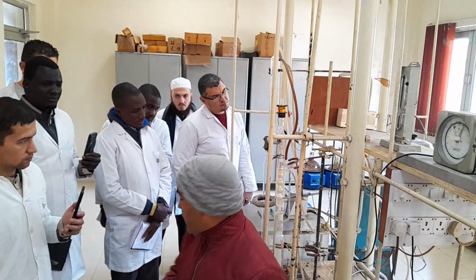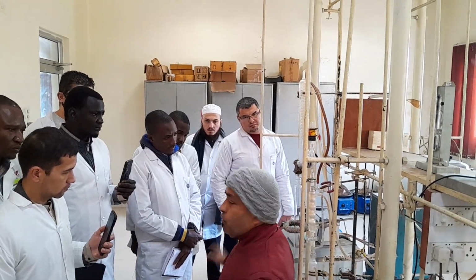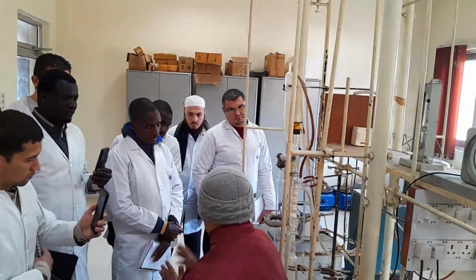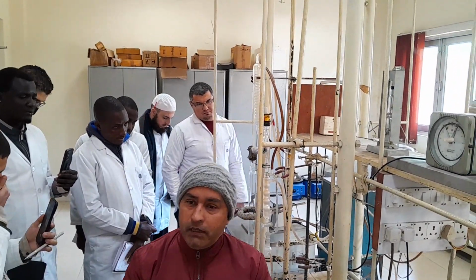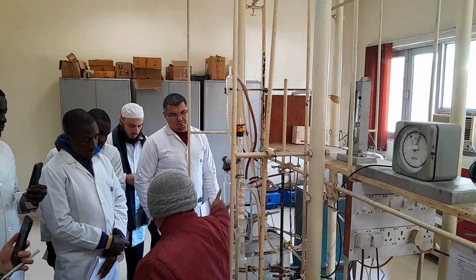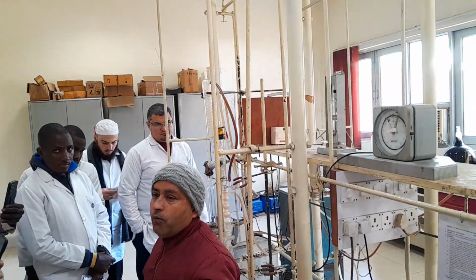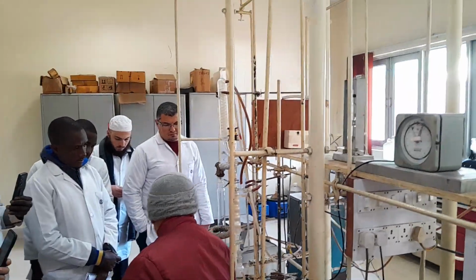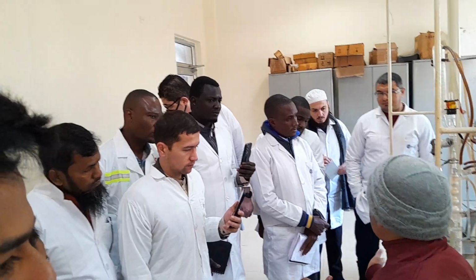Okay, so now the question is coming: how do I come to know my water has been removed? See, if there is water inside the crude oil, you will find haziness all over the column. Once water has been removed, you will see the column like this. It will seem transparent. So now you come to know, okay, my water has been removed. Once you have collected the water along with hydrocarbon, you will have to separate it out. Then you will have to take the weight.